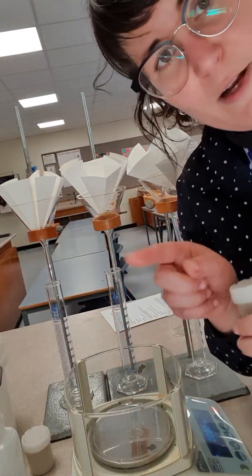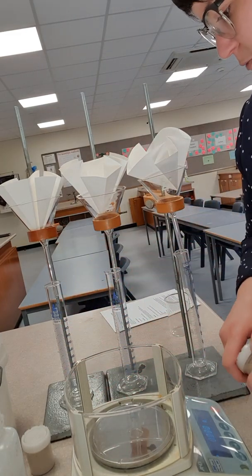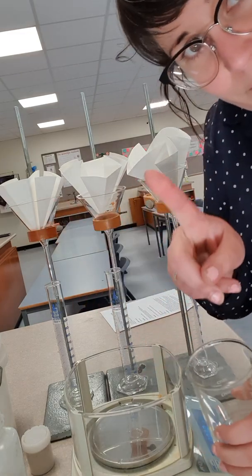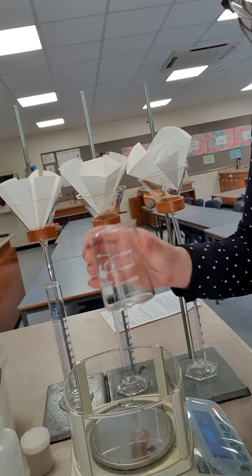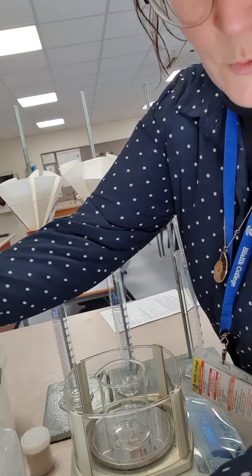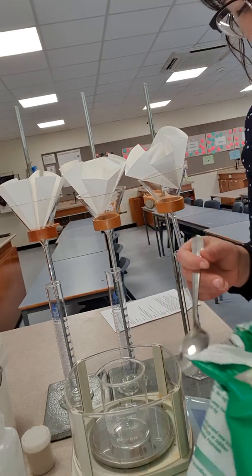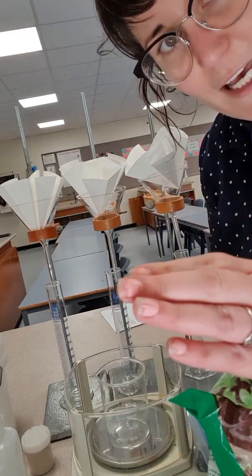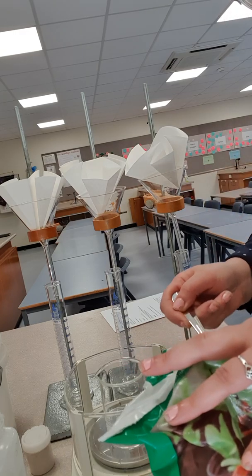I'm going to set it up, and when I set it up, I'm going to try and keep all the variables the same, so we can compare them with each other. So I thought I would weigh the same amount of substance into each one first. So my beaker on the scales, gonna zero that. We'll weigh out some dirt first. I haven't decided how much weight I'm going to put in there, but I thought I'd just put some dirt in the beaker and get a vibe for how much I want to use, and then make everyone after that the same weight. Alright, so here we go.